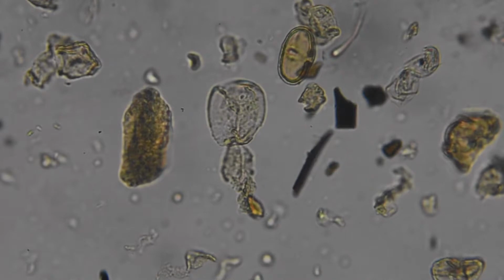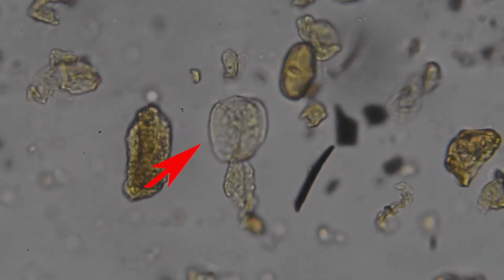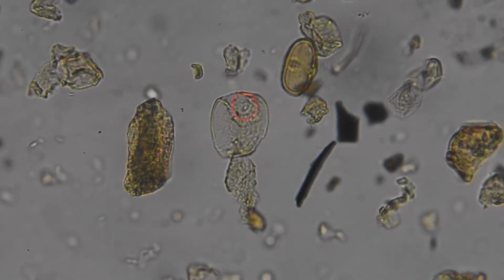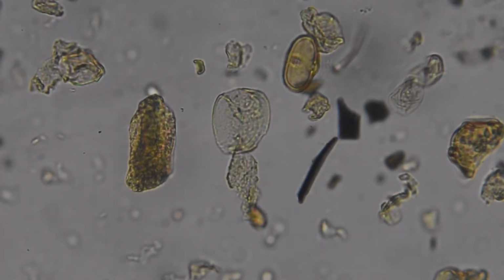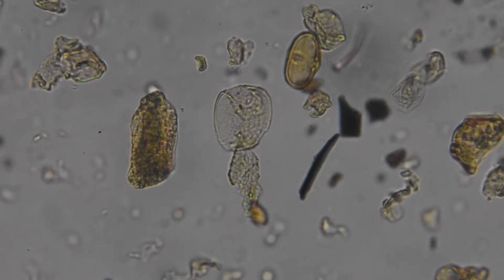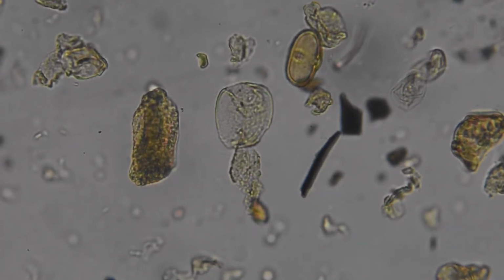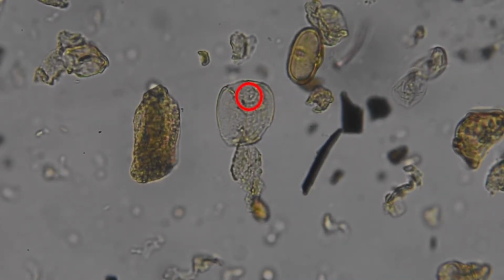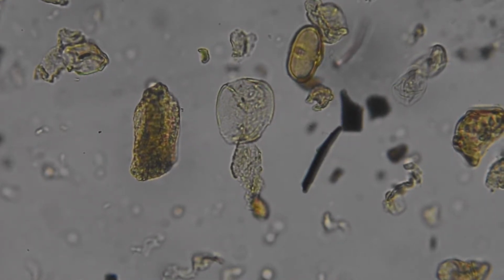at different times. So what we've got right in the centre here at the moment is a grass pollen. Now, this is very billowy and it's very clear, and it has one pore. So pollen grains have pores, they have little hollows in them, but they also have lines as well. And some will have both, some will have pores and lines, and some will just have lines, and some will just have pores. So that one there is a grass pollen, and we can see its pore just there. But let's go for a little bit of a wander on this slide and see what else we can find.